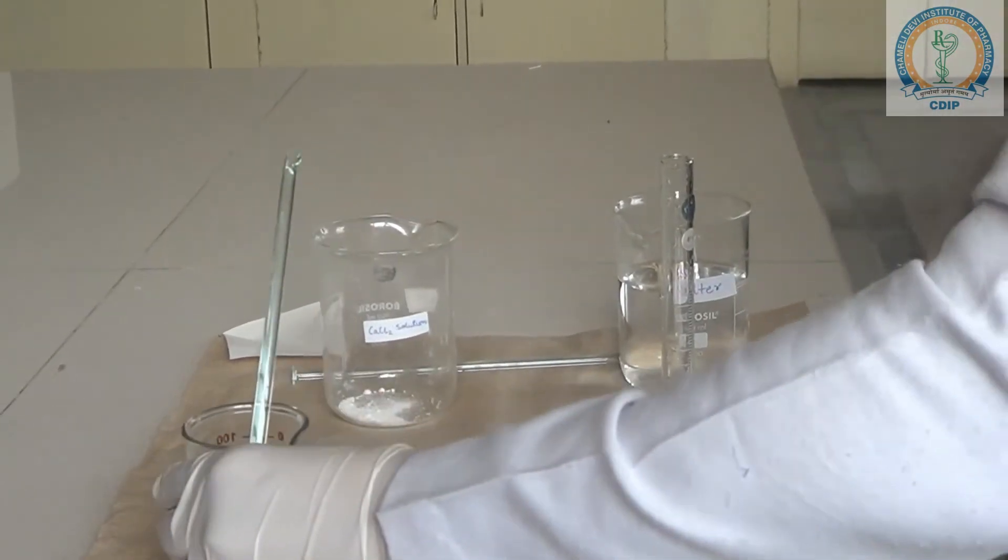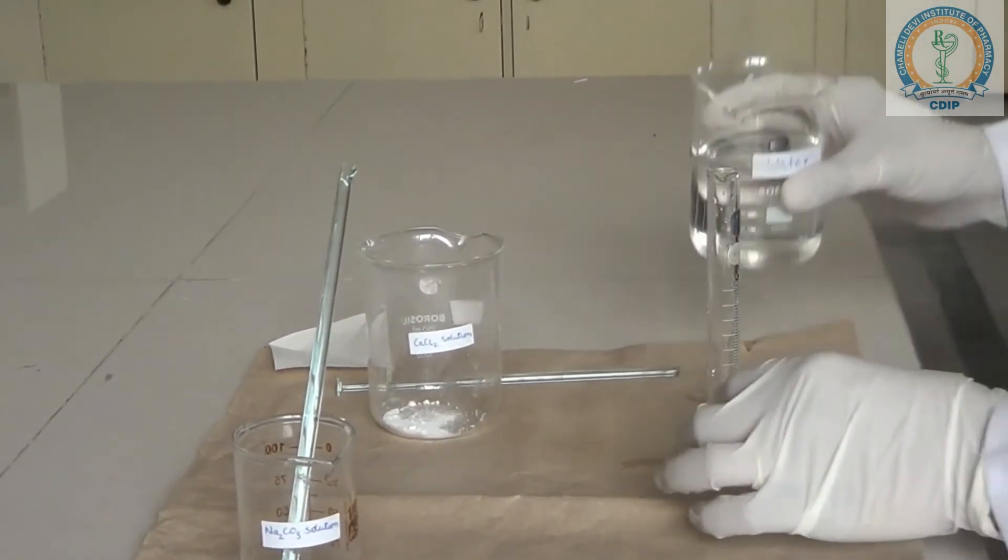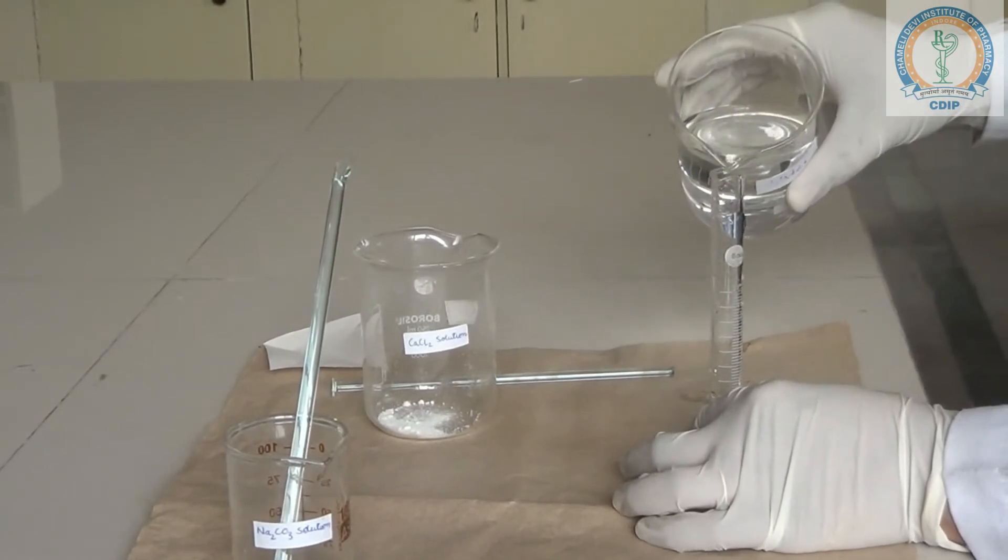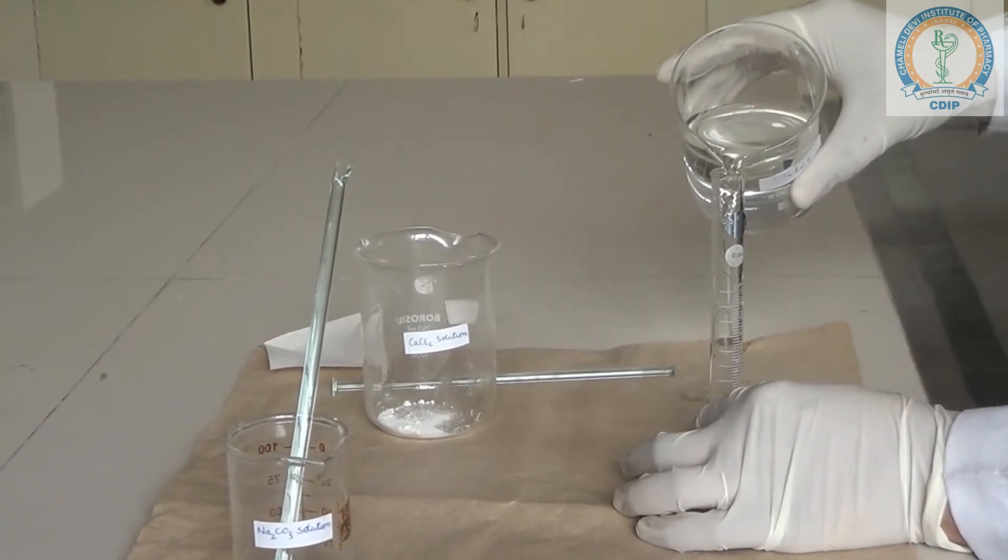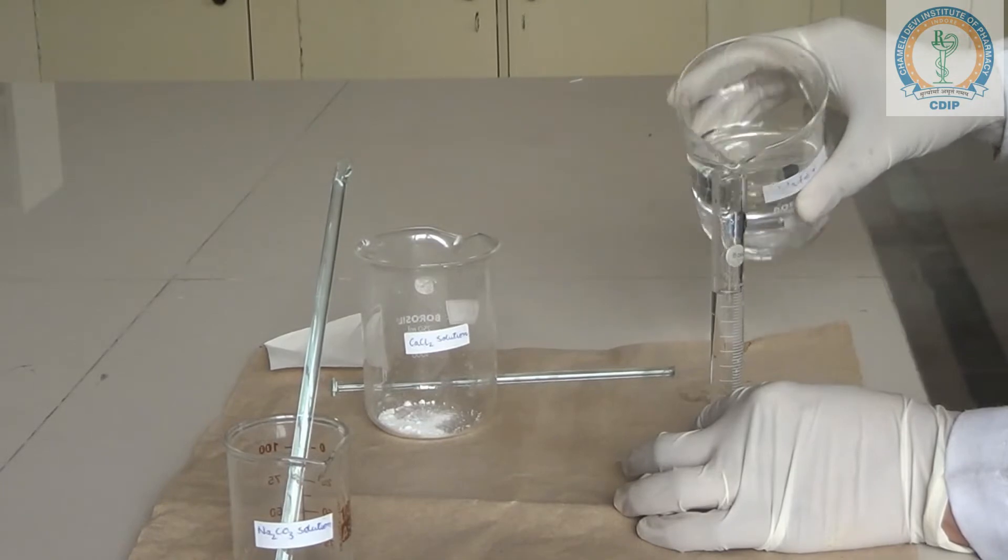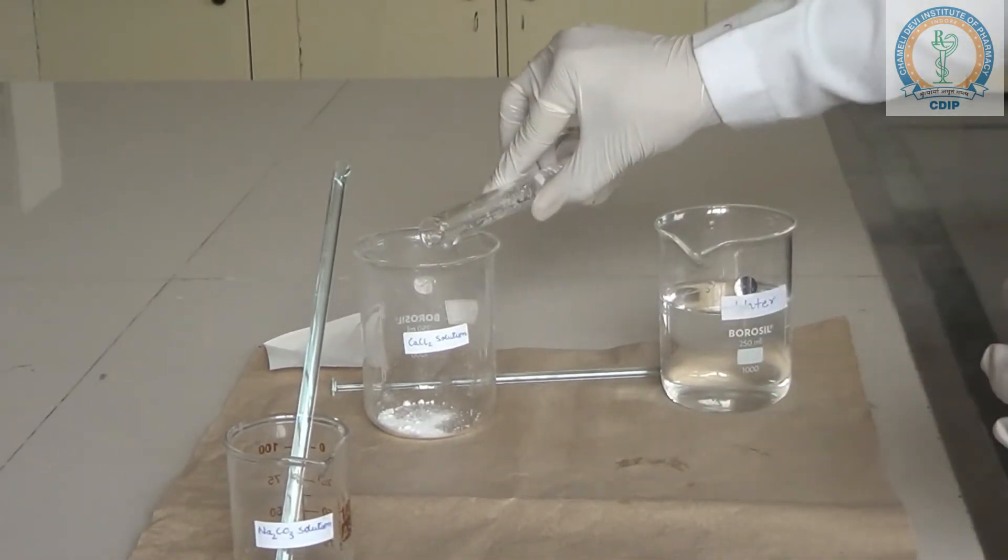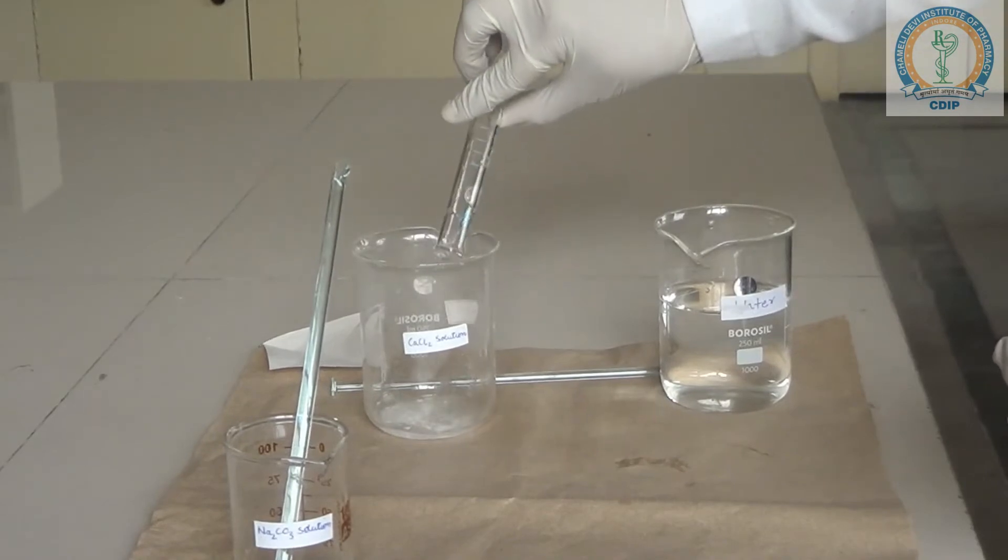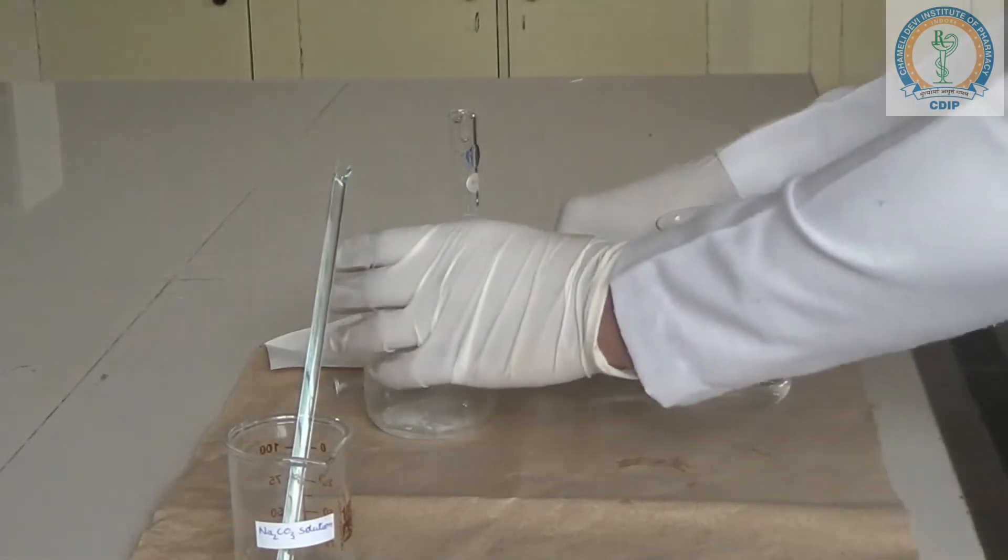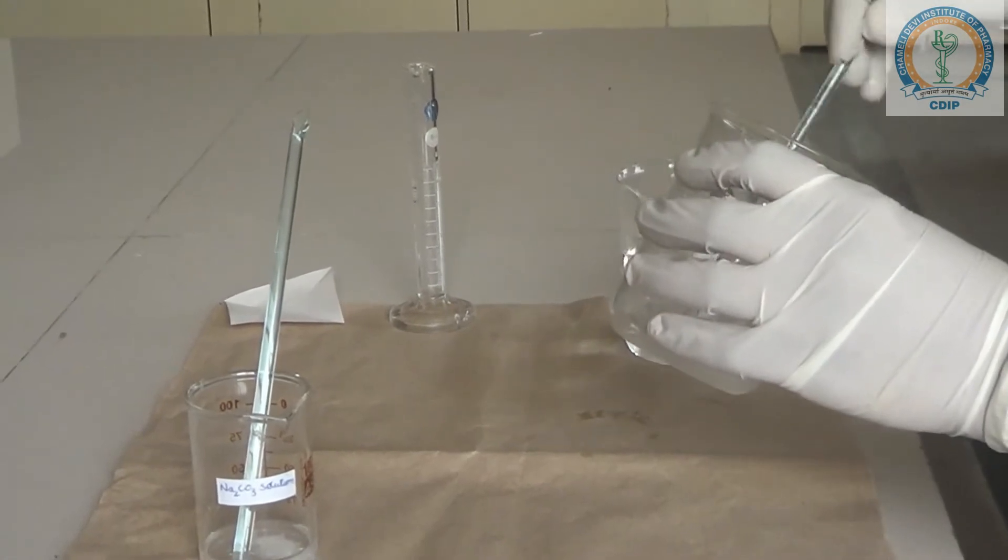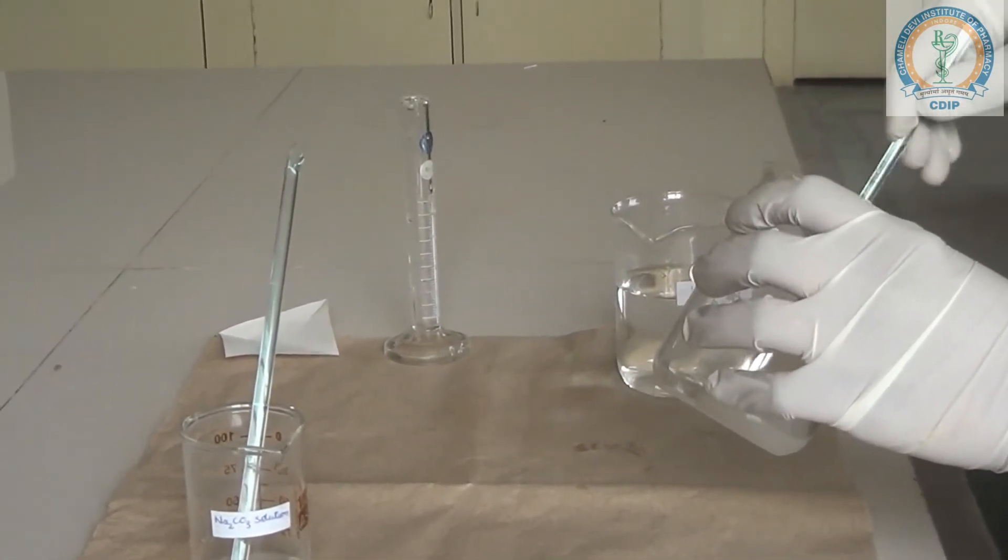The same, we are transferring 10 ml of distilled water to the calcium chloride solution and dissolving the same. Dissolve it completely, properly.